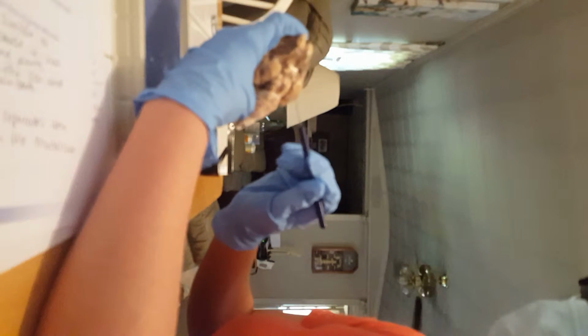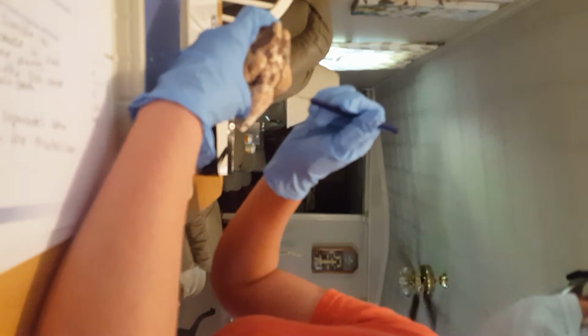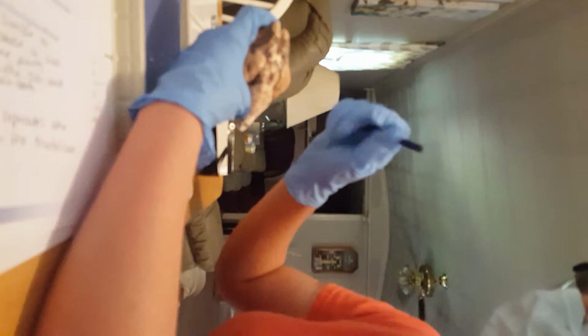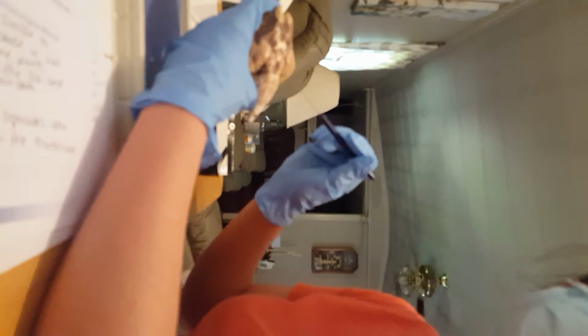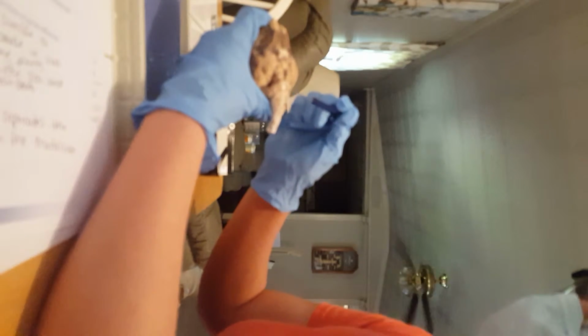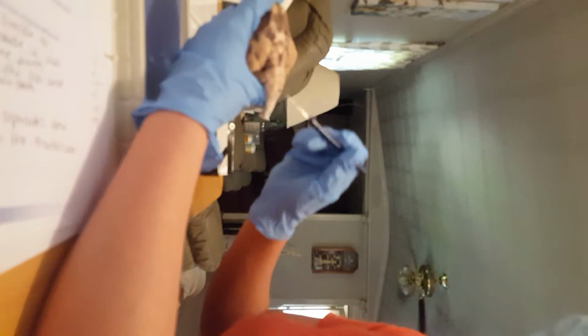Then there is the pituitary gland, which is right here in the center. The midbrain is, of course, all right here. In case you can't see me, I hope you can. The pons are right here. Kind of where the brain stem goes into. The medulla oblongata, that's right here. Also, kind of where the brain stem is.